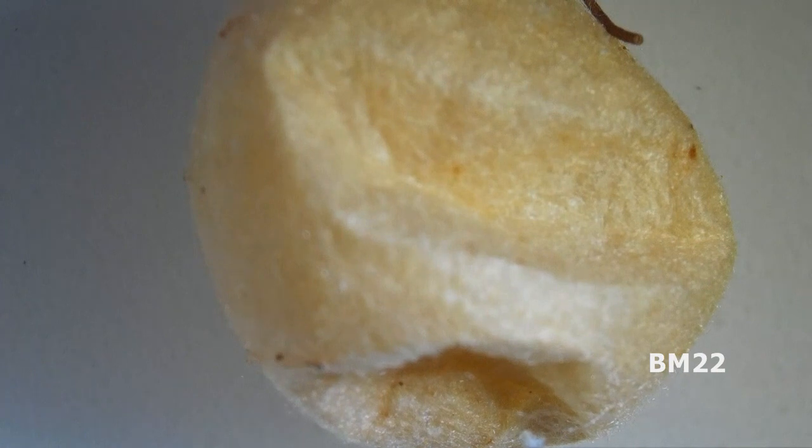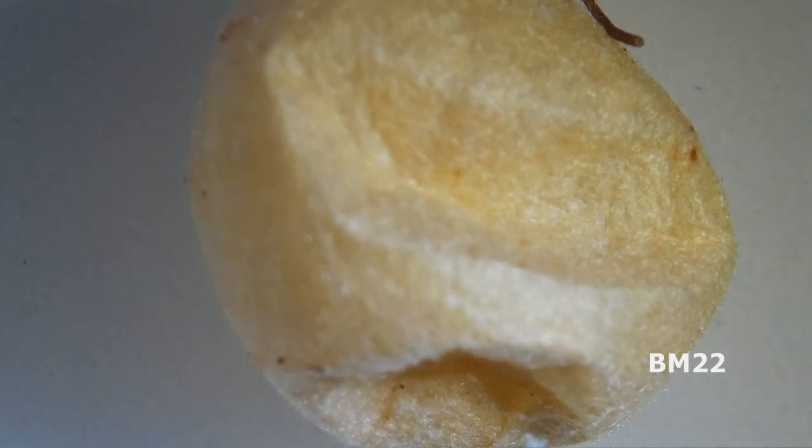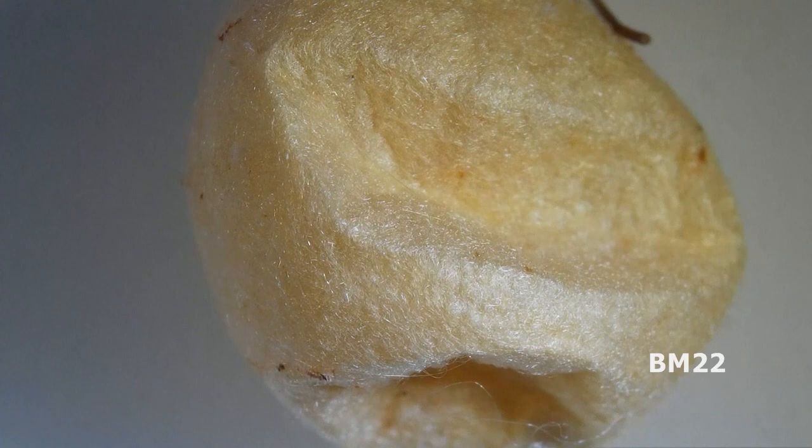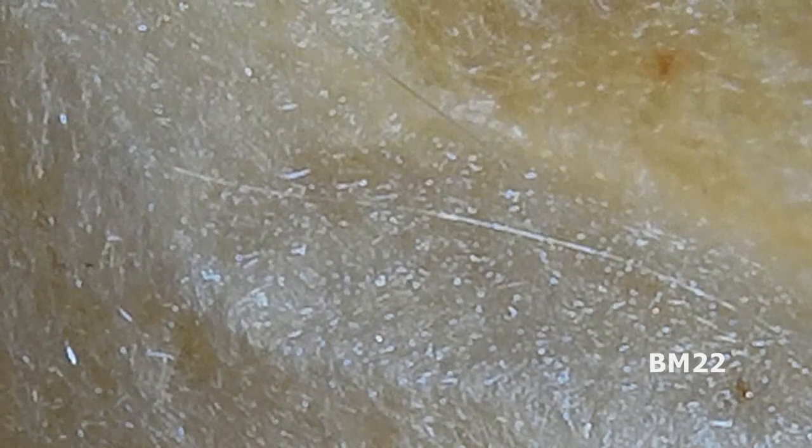All right. Now let's open up the last egg case. This one's a little different. It looks dark like it was ready to hatch.